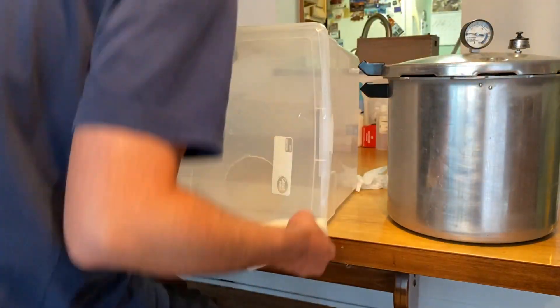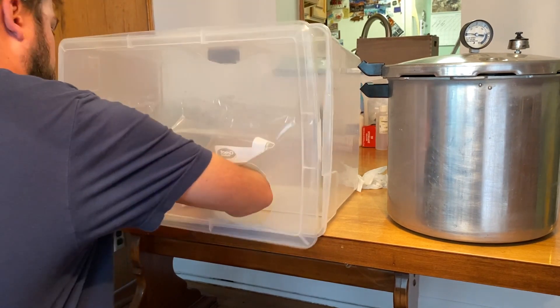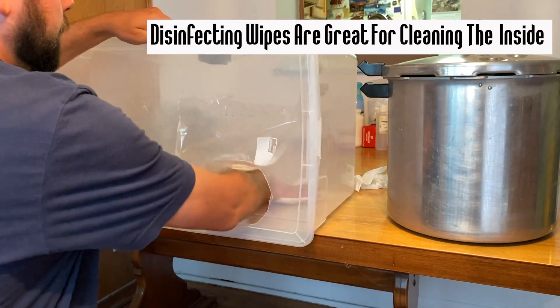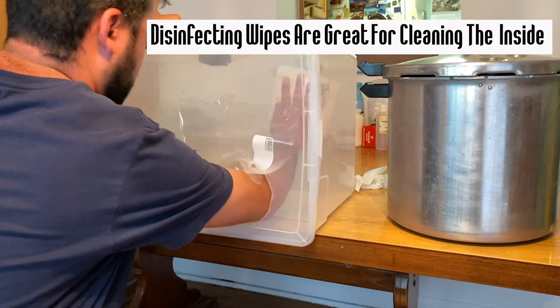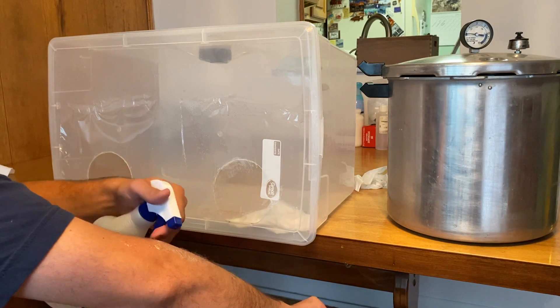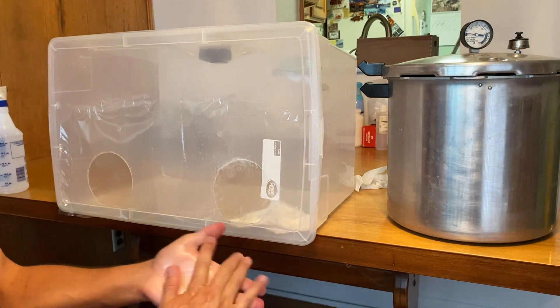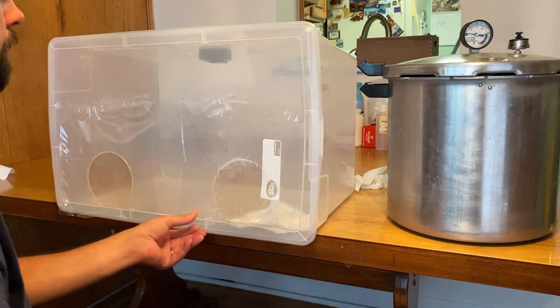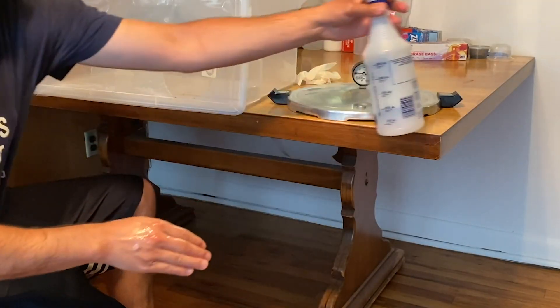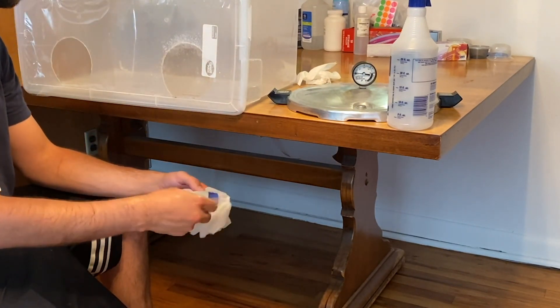I take some sterilized paper towels and spray a little more rubbing alcohol inside, wiping it down from the outside. Before I put my hands in, I spray those down with rubbing alcohol and sterilize my hands — you can also use hand sanitizer for this. If I had aluminum foil I would have wrapped some paper towels in it to have them inside the still air box during tissue culturing, but since I didn't I used the paper towels to wipe down the inside of the box.